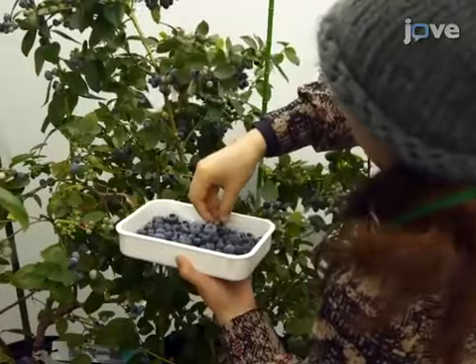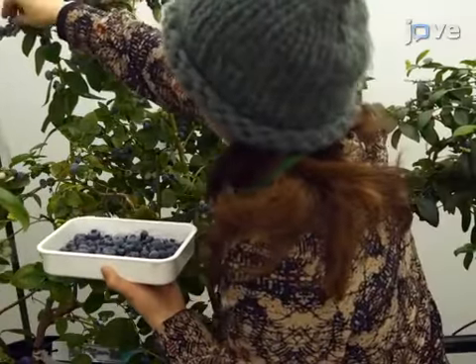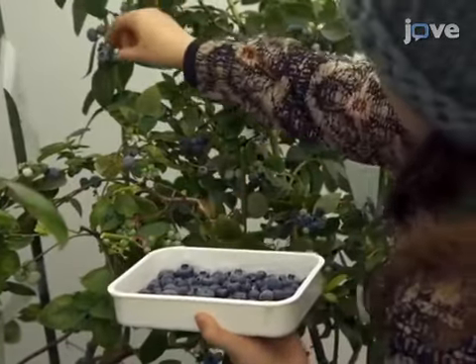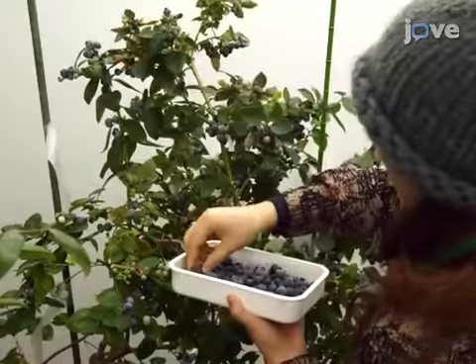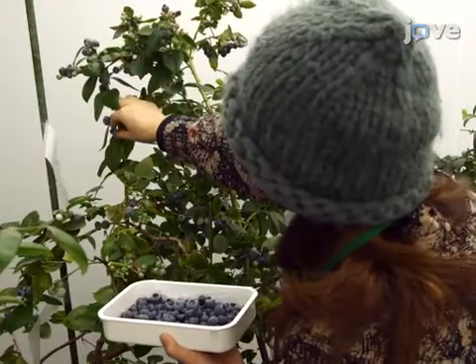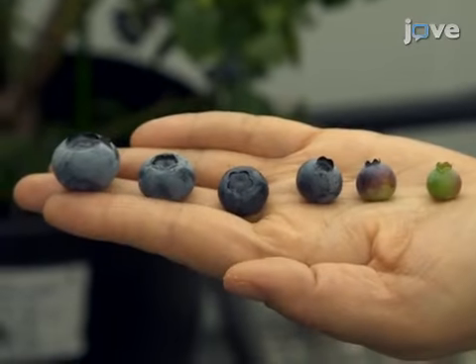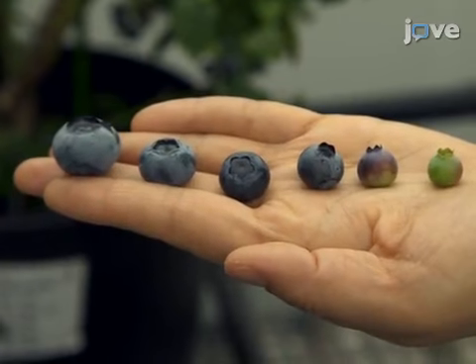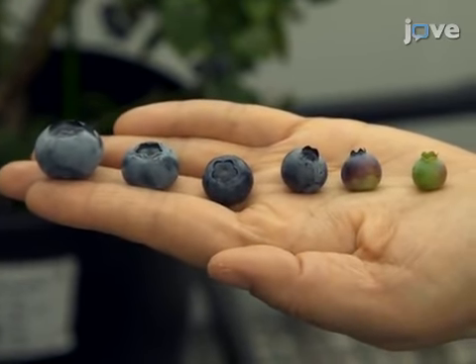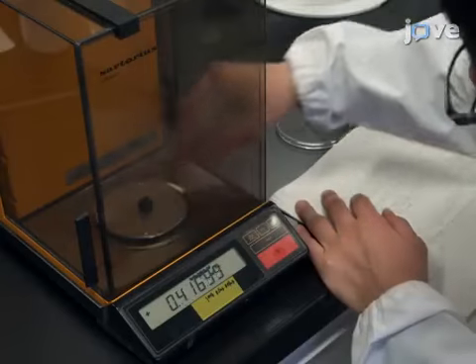Collect a sufficient number and various types of sample blueberries from the target cultivars. Collect preferably 100 blueberries for the construction of the calibration model, and at least 10 for the validation of the constructed model. To construct robust models, collect samples of various types, such as with various colors, sizes, and at various ripening conditions. Weigh each blueberry.